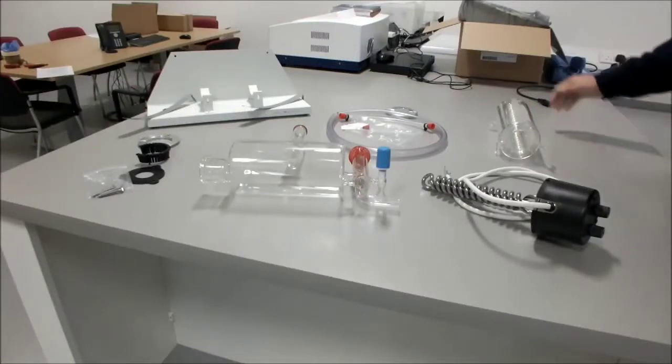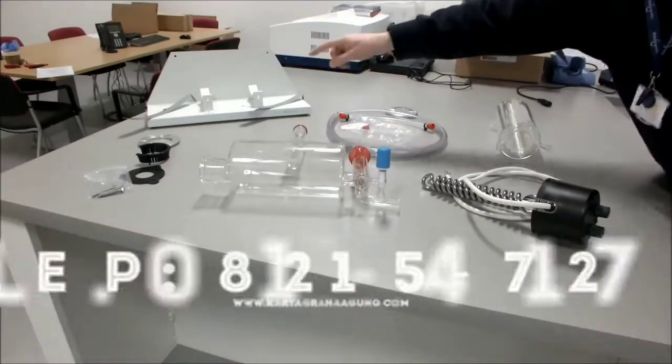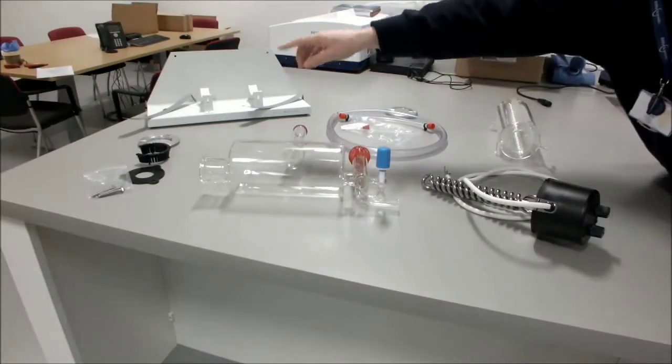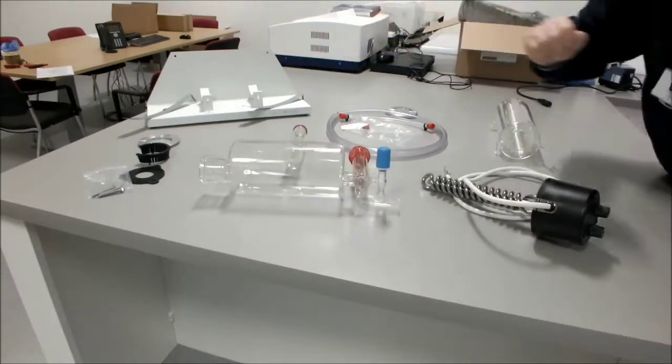Check the contents of the box. You should have a boiler stand with two straps, the gasket kit which consists of the flange, the plastic insert, the rubber gasket and three screws.